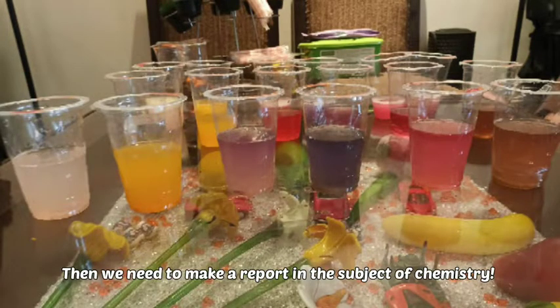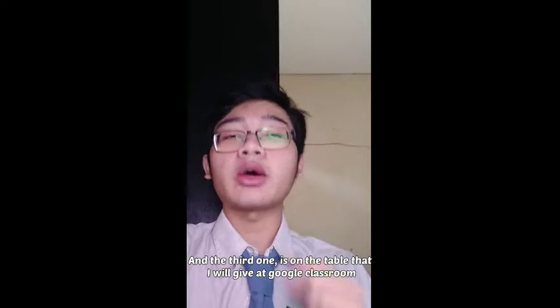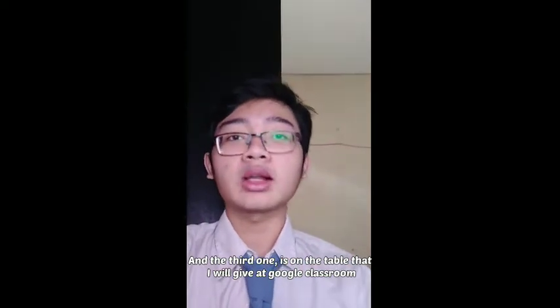Then we need to make a report in the subject of chemistry. The conclusions that we can get from this experiment are, first, that we all know how to do an experiment using natural indicators of acid and bases. The second conclusion is that now we know that all of the natural indicators can function very well. And the third one is on the table that I will give at Google Classroom.